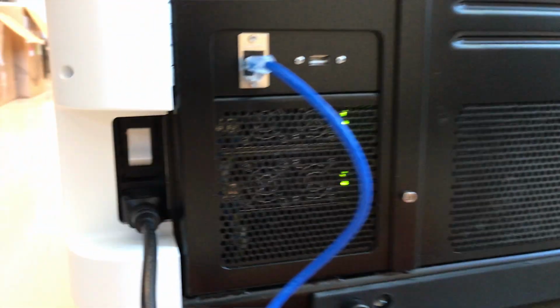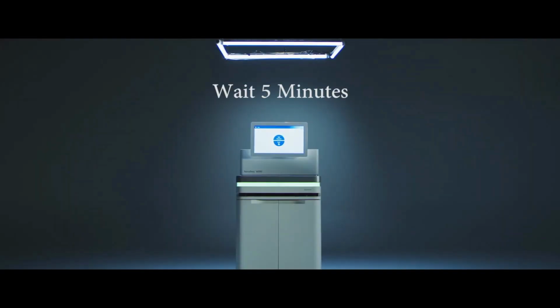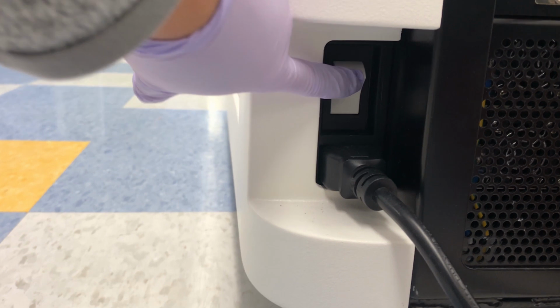Locate the toggle switch at the bottom right rear of the instrument. Toggle the switch down to the off position. Wait 5 minutes. Then, toggle the switch up to power on the instrument.